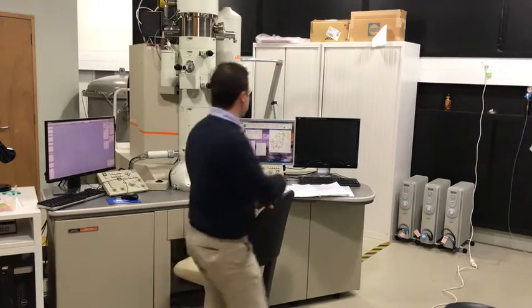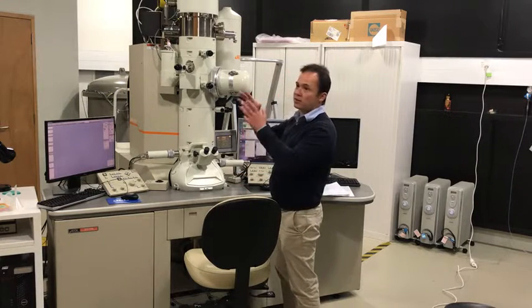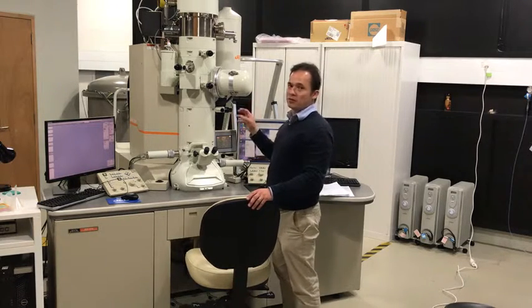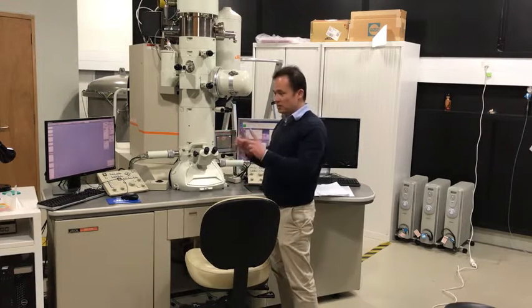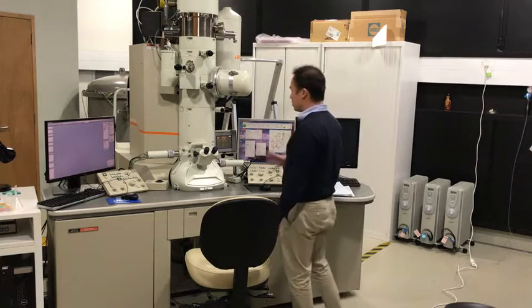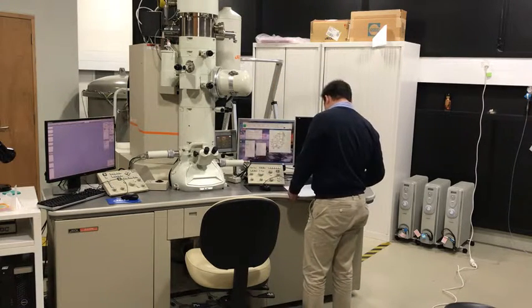Because what happens is when we bake off the cold trap, the cold finger, during the cryo cycle, all the gunk that's condensed onto the cold finger will evaporate, and if it then condenses all over these tiny little apertures, you know, they're only a few tens of microns in diameter, then you'll make the apertures dirty, which means you won't have nice, clean, circular edges. And that means your optics are going to be terrible. So you must remove all apertures before you bake out the cold trap.